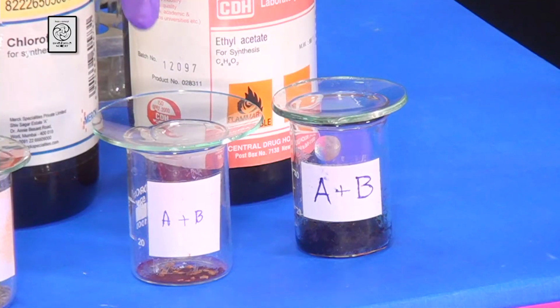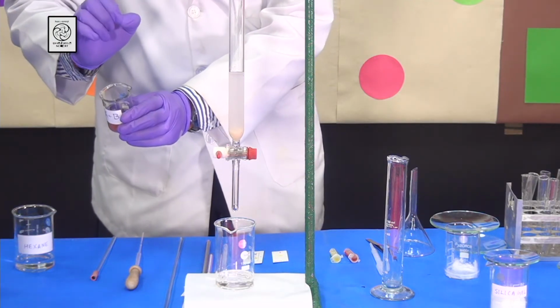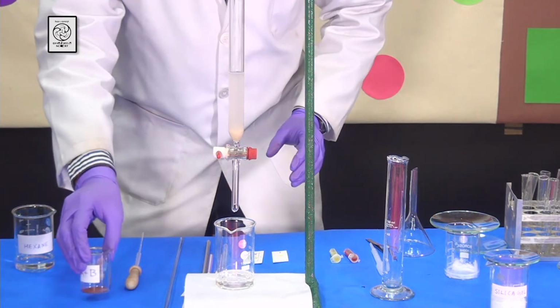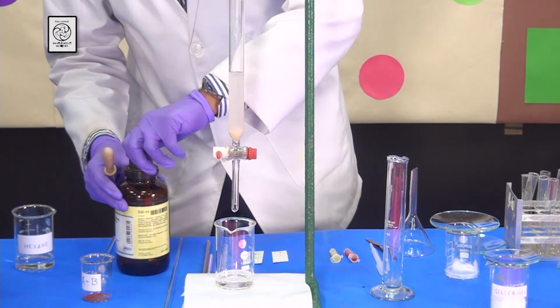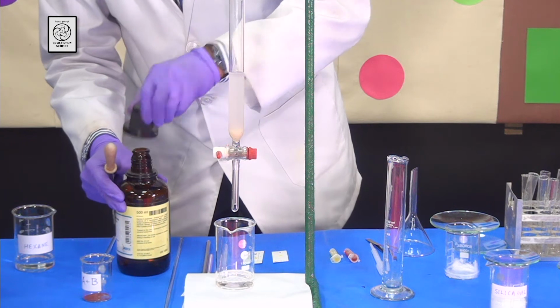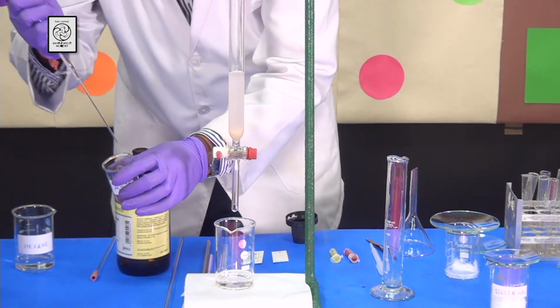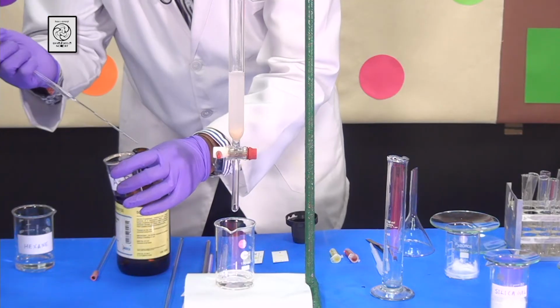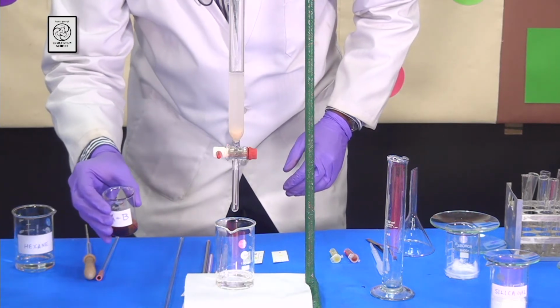So students, now I am going to take the mixture of compounds which I am going to show to you here and add some chloroform to dissolve them and some silica gel to make a fine powder. Okay, so first of all, I am going to take some chloroform, a very little bit, and I am going to add it to them so that they are dissolved. Make sure that they are almost completely dissolved.